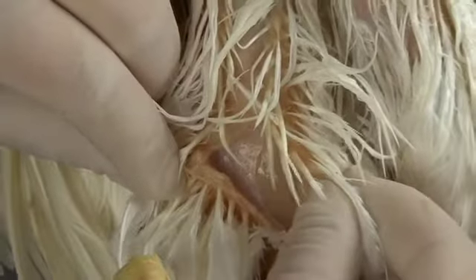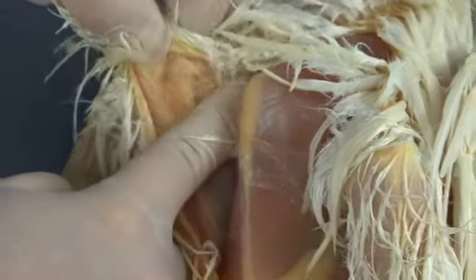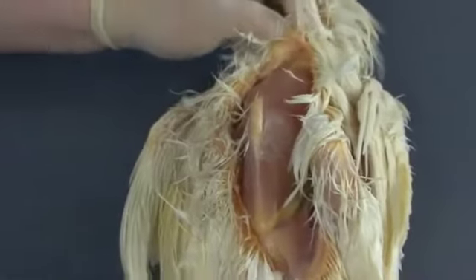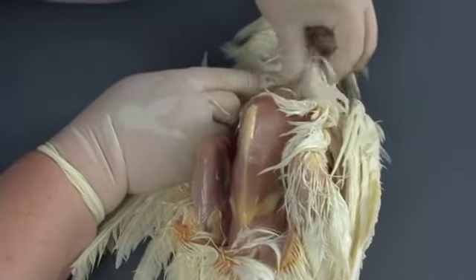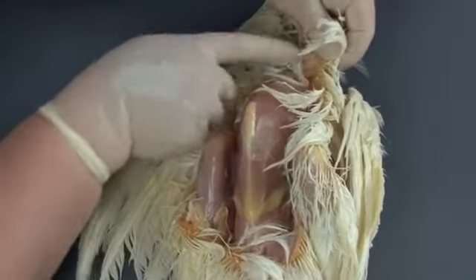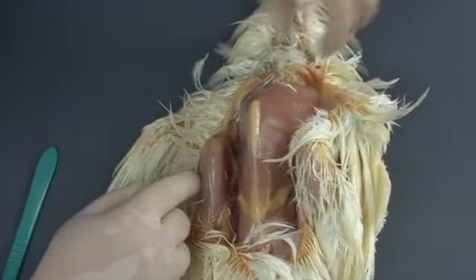A good technique is to elevate the skin to create tension and use your fingers to pull it away from the underlying tissue. In a young bird or a fresh bird, the skin is easily removed. In a mature bird, a water bird, or a bird that has undergone autolysis, it's harder to separate the skin from the subcutaneous tissue. It's important to perform this procedure carefully to avoid penetrating the body cavities, as this could contaminate the tissues and compromise laboratory testing.